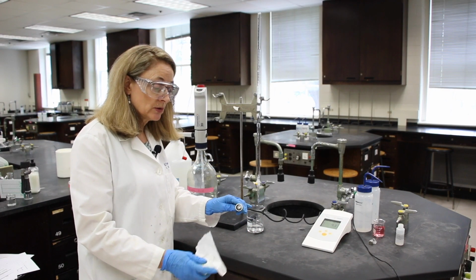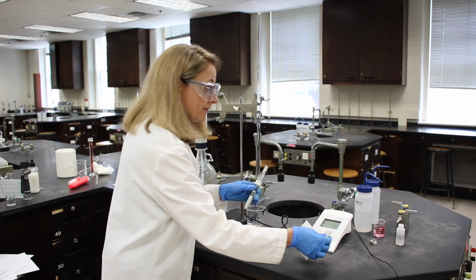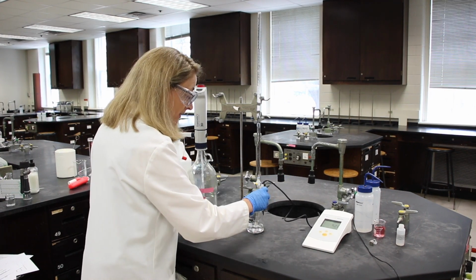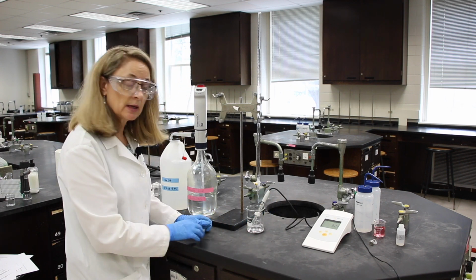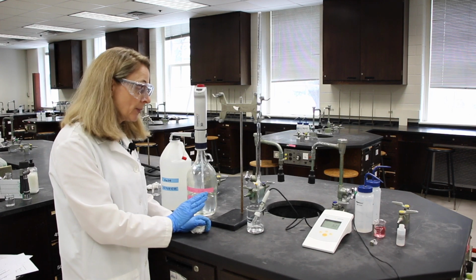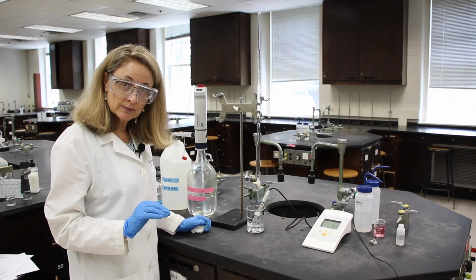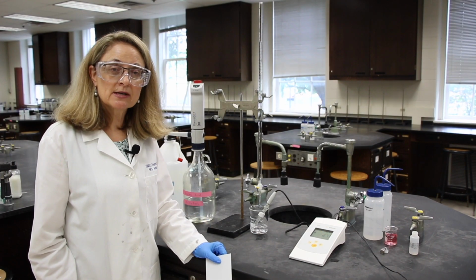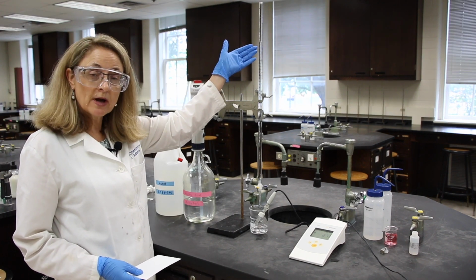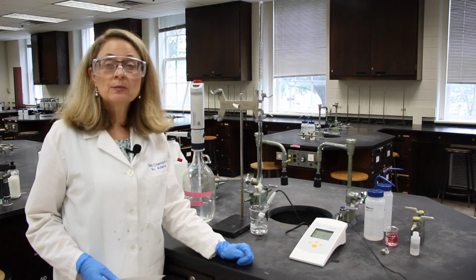Now I'm just going to blot the end of the pH electrode with a paper towel just to get that pH 7 solution off of it. And then I'm going to insert it into the acetic acid that we've put in our beaker. And I'm going to let that stabilize a little while, probably 2 to 5 minutes, so that the pH reading is very stable. Now that our pH has stabilized and we've read our initial reading, I read it as 9.25 milliliters, and our initial pH is 2.74.